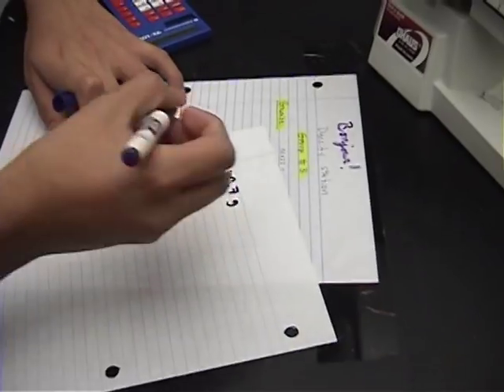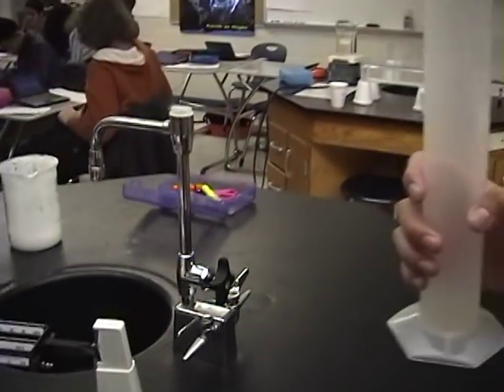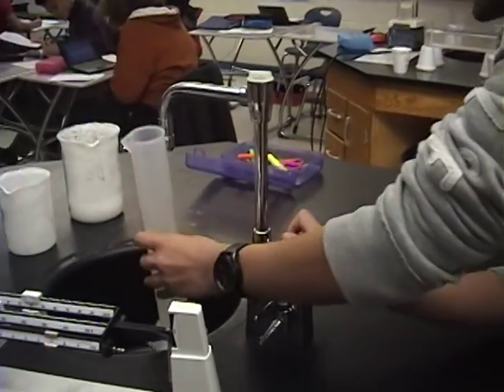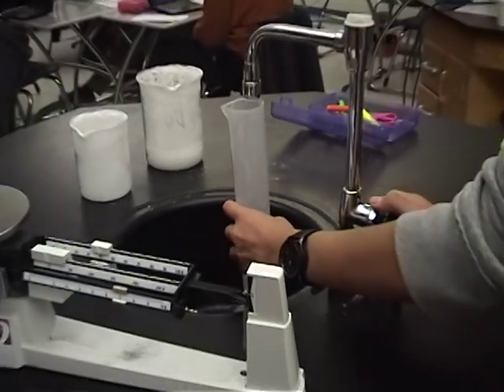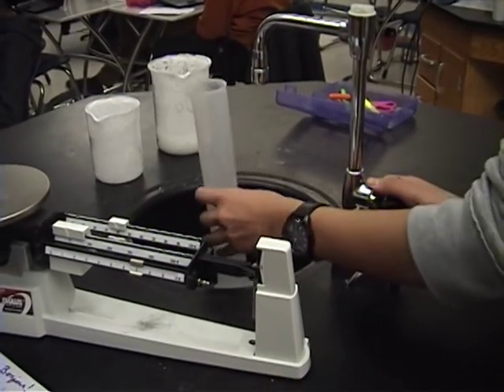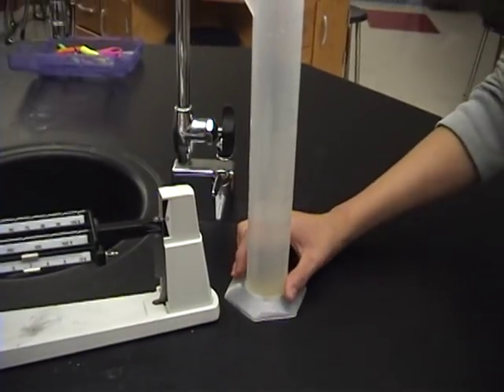Did you see that mistake? Because I saw that mistake. And then you've got to find the volume of the basalt. To find the volume, you have to put water in this thing. Yes. Water. Alright. So we take the measurements of water. It's 120 ml. So 120.